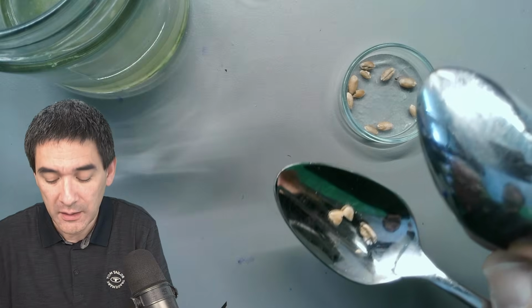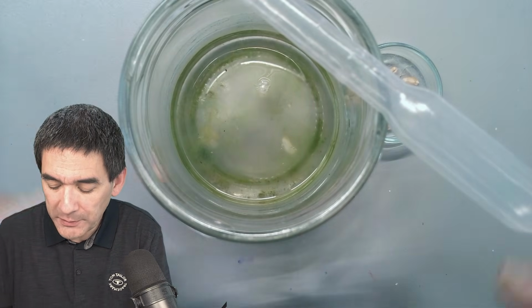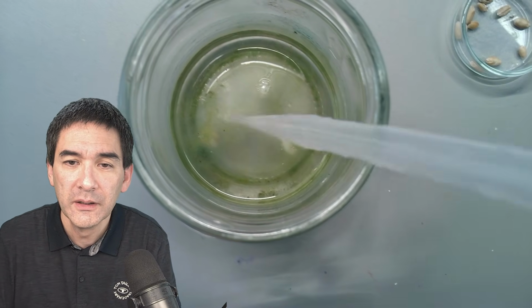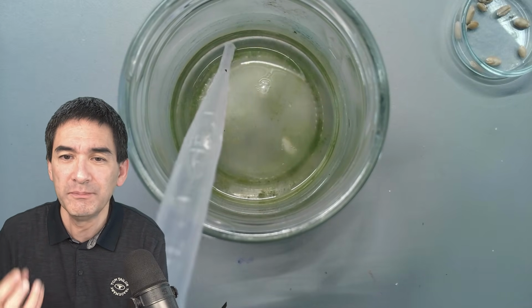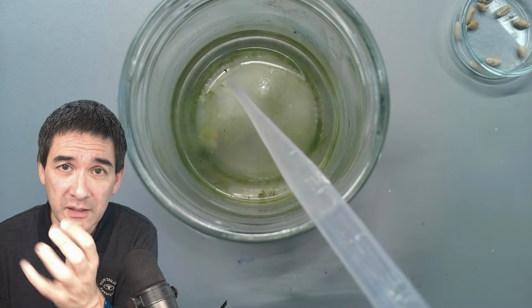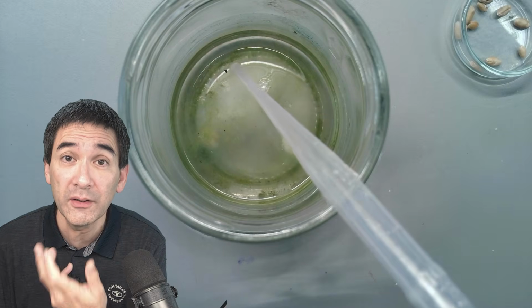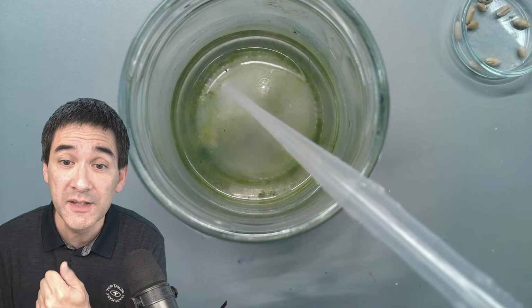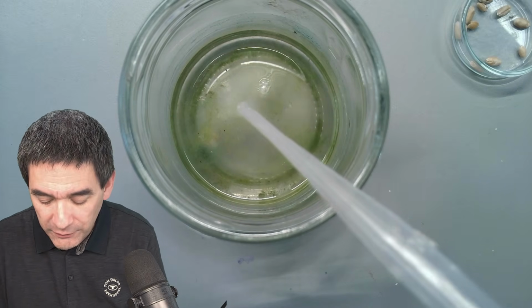I have done this last week, and what you will see is the following. As a matter of fact, I dropped in three pieces, and there's one of them over here, one of them over here, and this third one is over here. You're going to see it looks very slimy and fuzzy, and that is indeed the case, because after a couple of days it looks like there's some kind of slime layer growing around it. So there are bacteria growing there, and where there are bacteria, then of course also the larger ciliates will feed on the bacteria. So what we have is a small food chain. I simply let it stand there for almost a week, actually around 5 days.